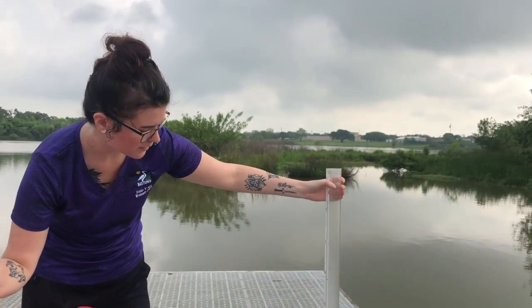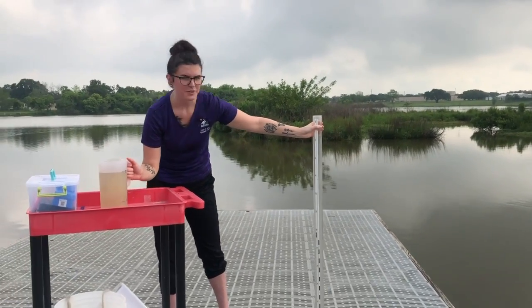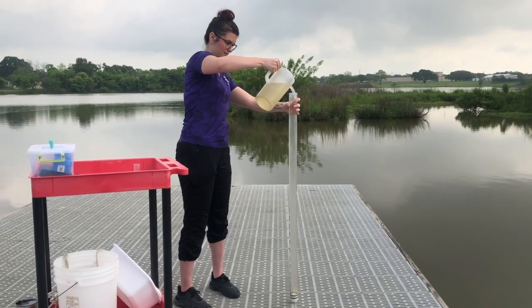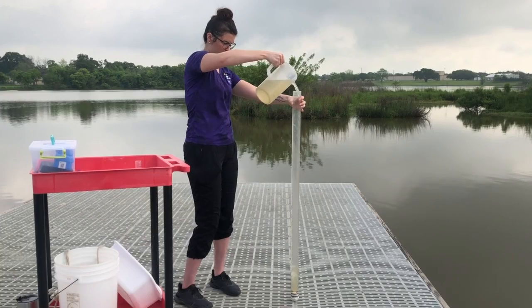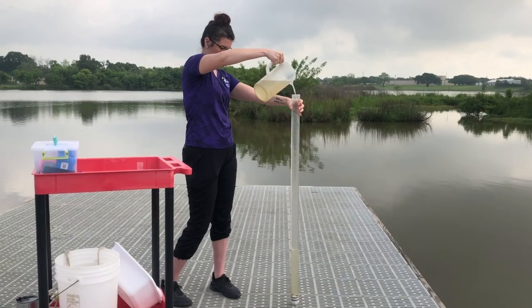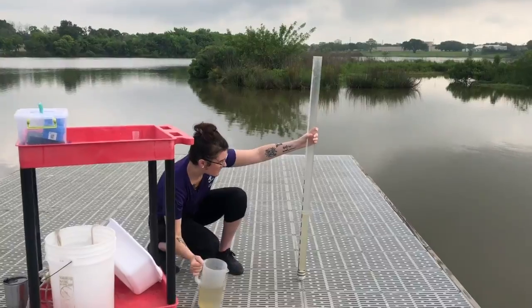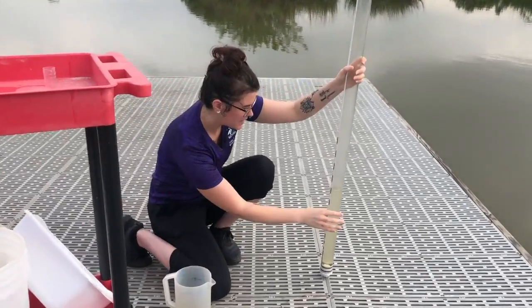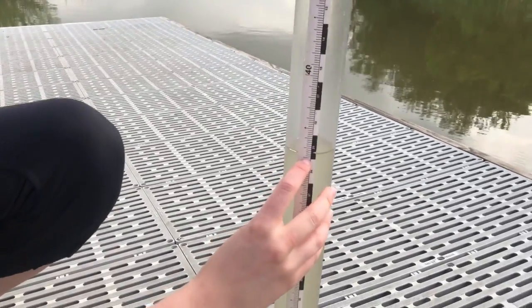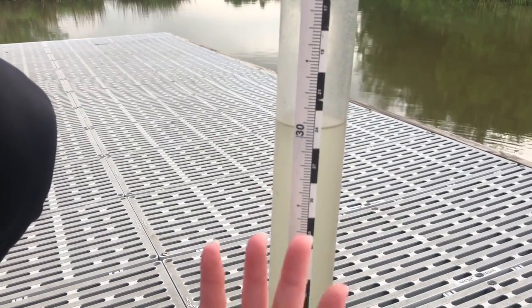I'm going to pour some water in it. I'm going to try to do 32 centimeters. So I'm going to pour my water in. Can't really see. All right, so right now it's at about 35, and it's going to empty a little bit. It's going to let water out, and right now it's at 32. But this one's a little defective, and it keeps letting water out, so we passed 32.